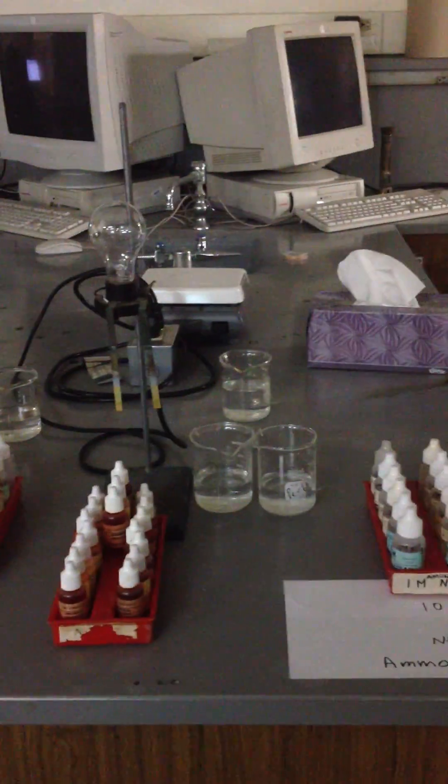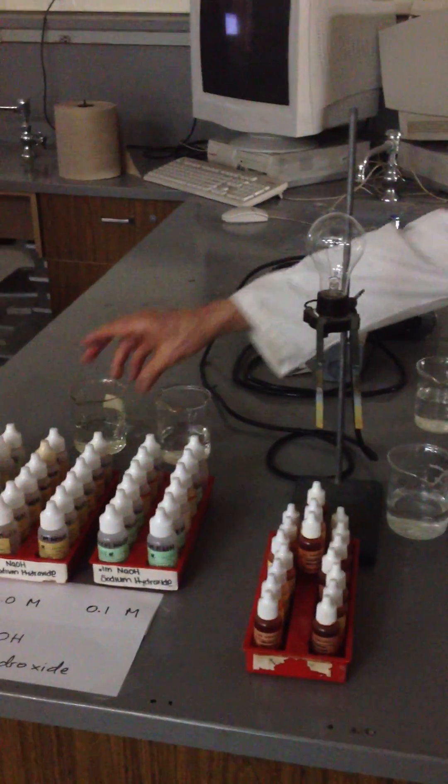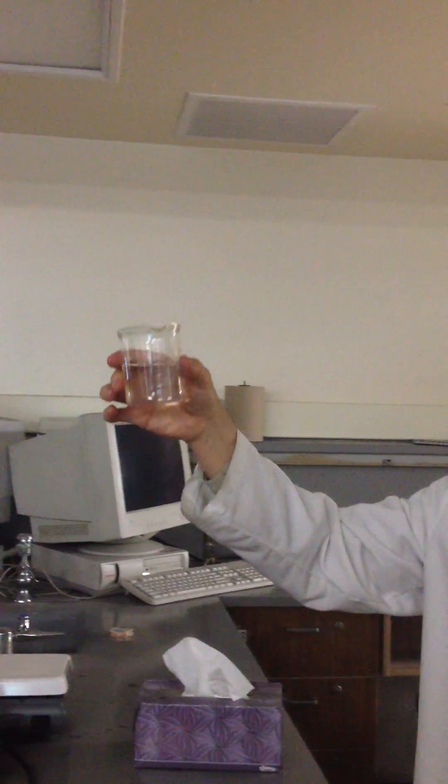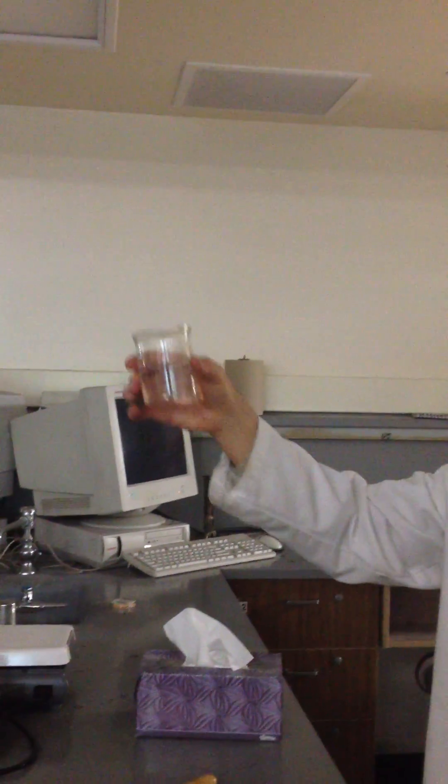So we're going to test three, four different chemicals after I prove to you again. I think you've all seen this before. Those of you who can't see because someone's there taking the picture, move off to the side so you can see what's going on.